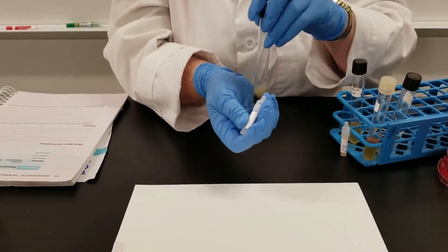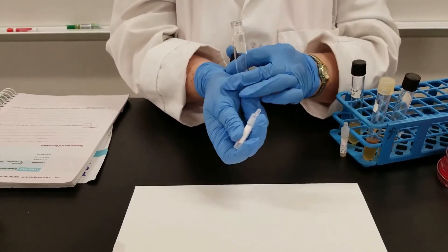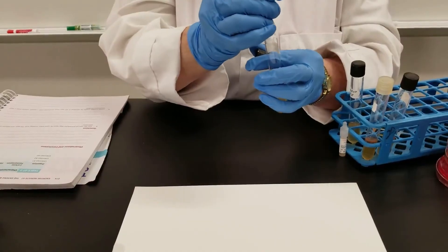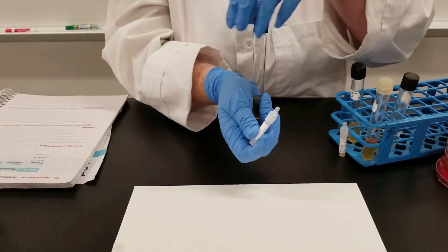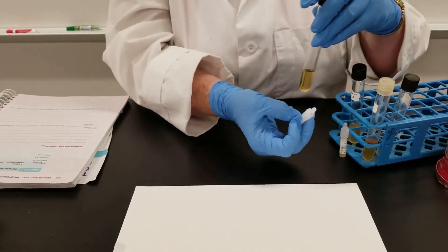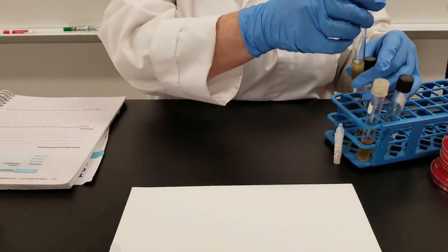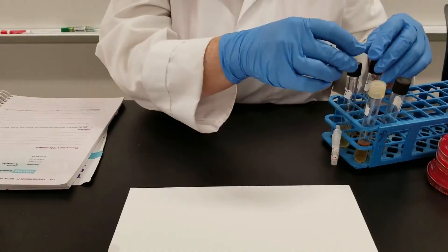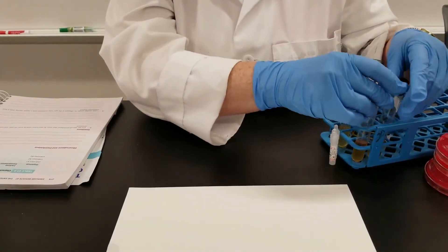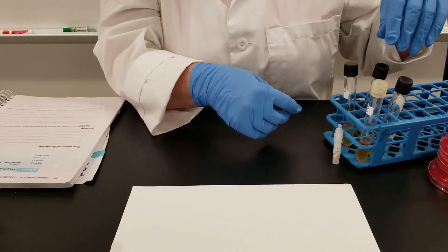If it turns red it is positive, if it remains yellow it is negative. And yes, sometimes we need to let these sit a bit longer for the reaction to take place, so we will set this aside and look at them later. Thank you.